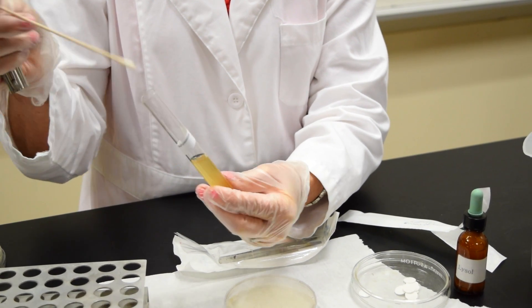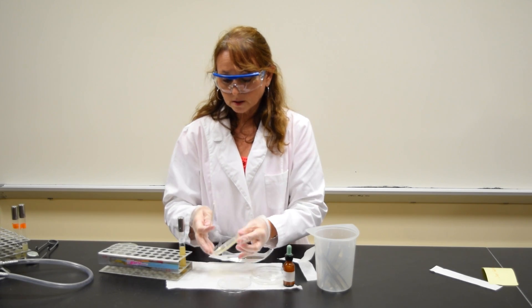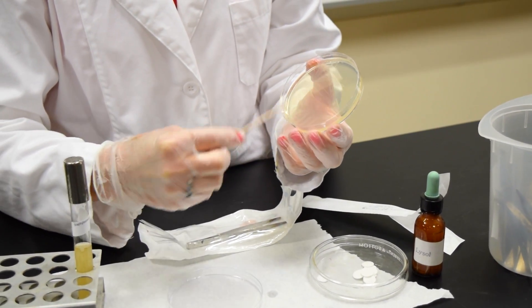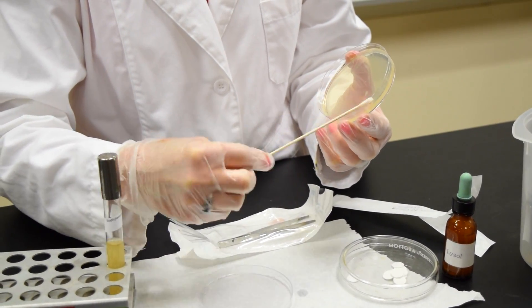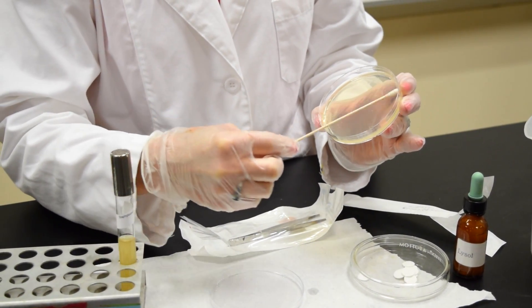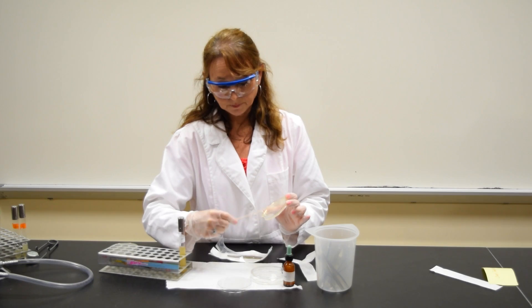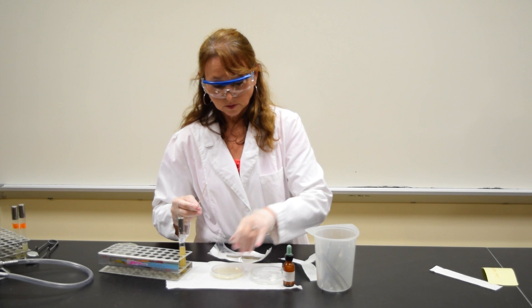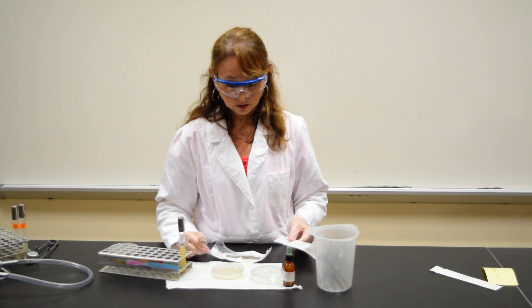Gently press it on the inside of the tube. Take your petri plate and you want to try to swab the organism evenly over the entire plate. I'm going to give it a quarter of a turn and do the same thing, swabbing from top to bottom. The swab then goes into the package and eventually goes into the biohazard container.